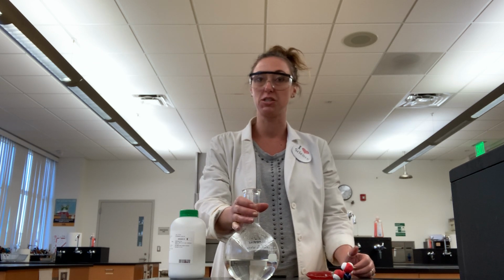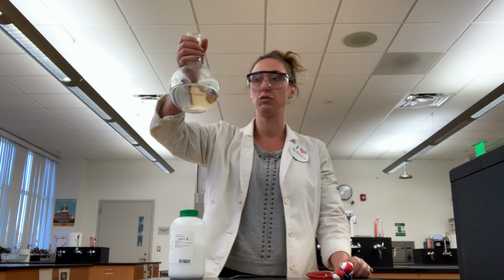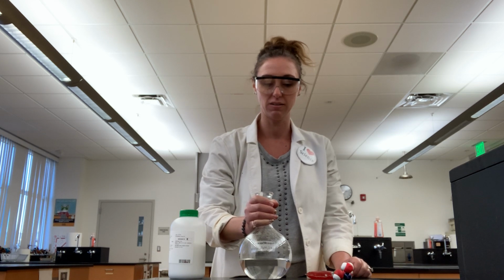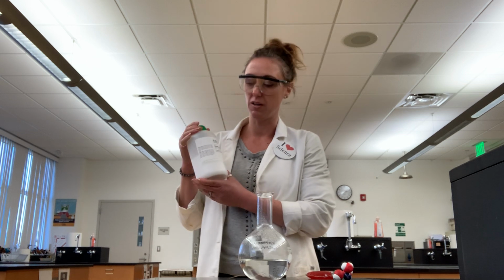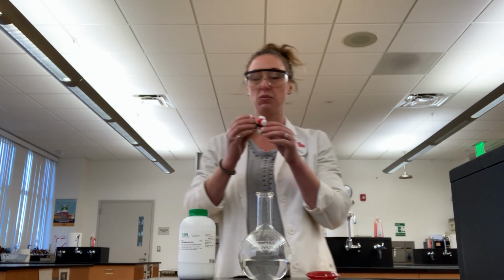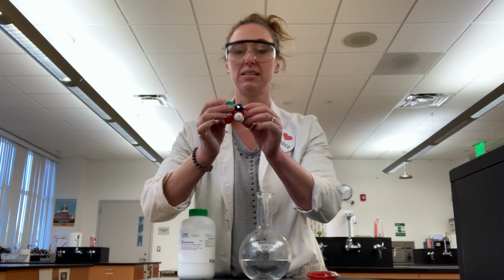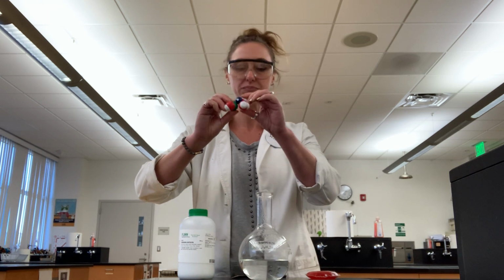I'm back at Miracosta High School in my lab and wanted to do a demonstration for you involving some solution chemistry. What I have here is a supersaturated solution of sodium acetate. Sodium acetate is an ionic solid at room temperature. As a matter of fact, it's what we call a trihydrate. So you can see here, this would be what it would look like in terms of particle view, where we have the sodium ion, the acetate ion, and then 3 water molecules associated with it.